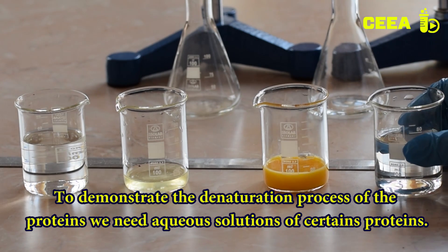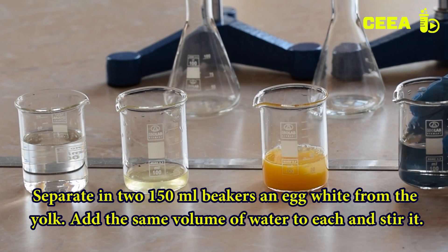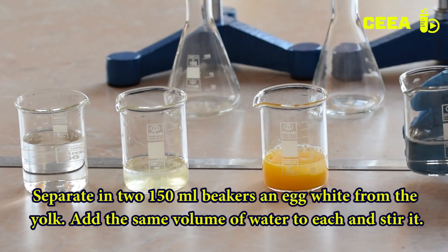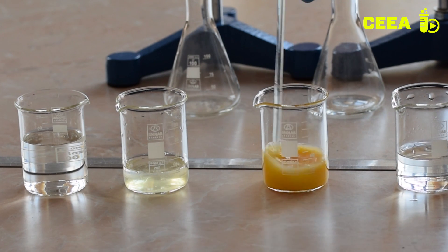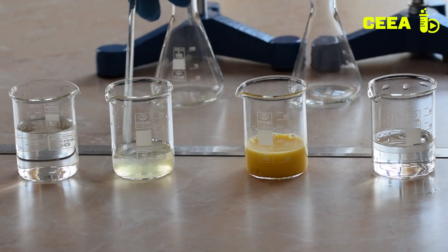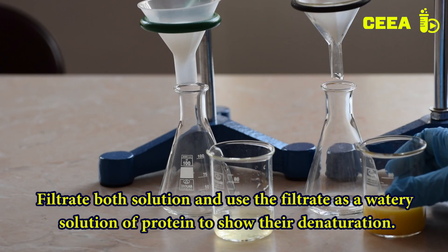Separate the yolk of an egg from its white and place them in two beakers. Add distilled water to make two protein solutions to be used in the following experiment. Stir with a glass rod to get a homogeneous mixture, then filter both solutions.